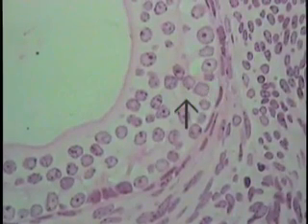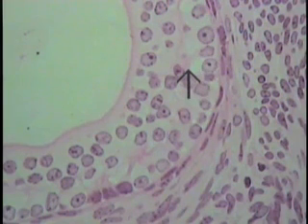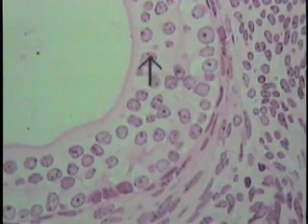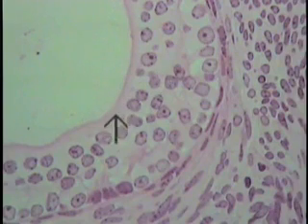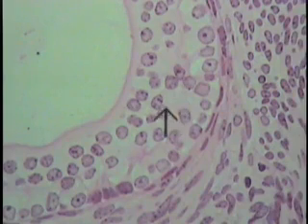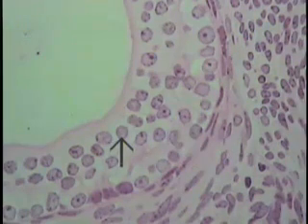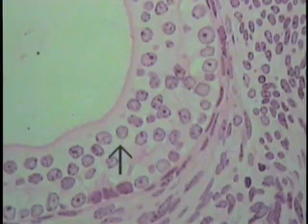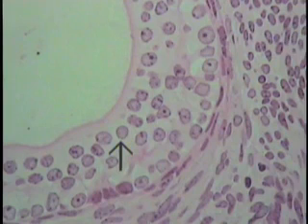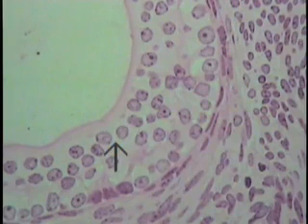At increased magnification, several features can be illustrated. Once again, identify the nucleus, the boundary of the cytoplasm which is approximately here, and nucleoli if they are present. Note that in some regions the cells are closely packed together and cytoplasmic boundaries cannot be discerned. When this condition is encountered, use the profile of the nucleus to give an indication of the overall shape of the cell. The cytoplasmic boundaries are very indistinct, and when this is encountered, use the nuclear profile as an indicator of the cell shape while cytoplasmic boundaries are estimated.